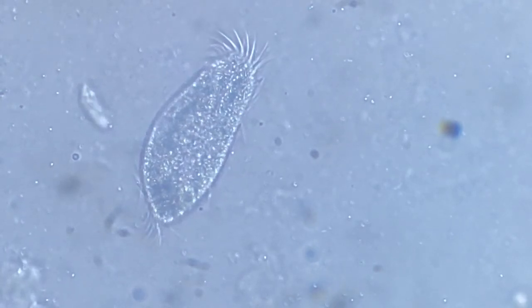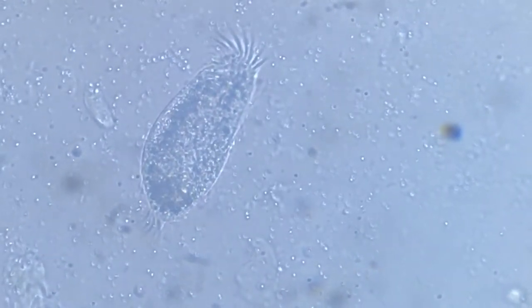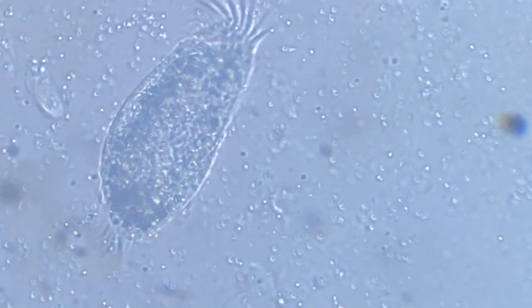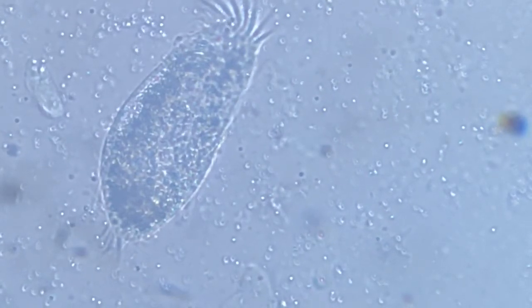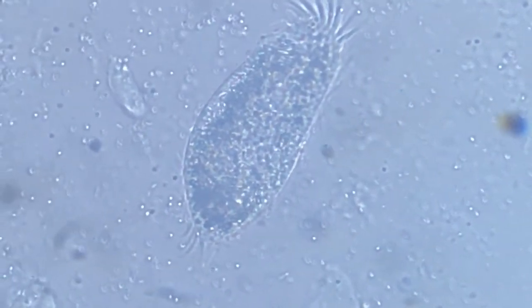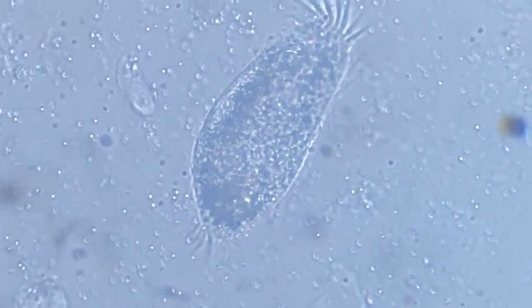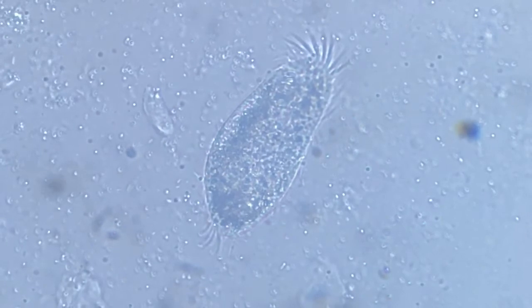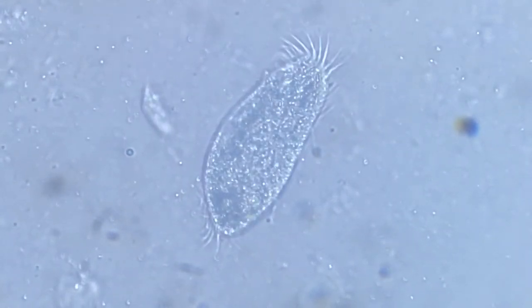When it dies, it will explode slowly. You can see protoplasm oozing out, the body becoming swollen because water is ingressing into it. And it shall soon just dissipate.